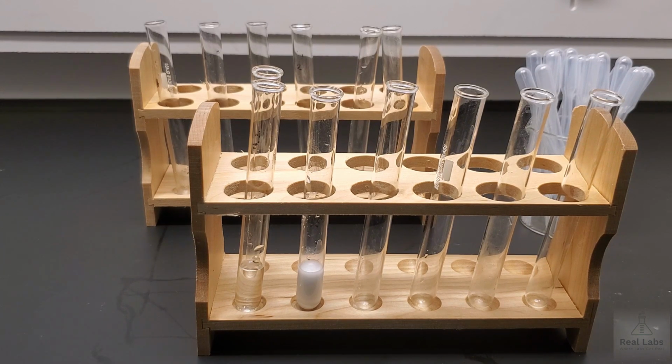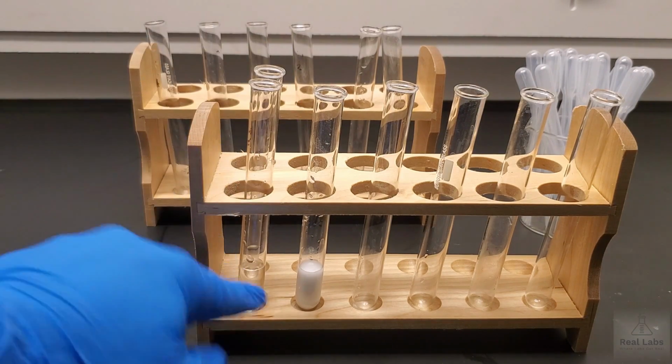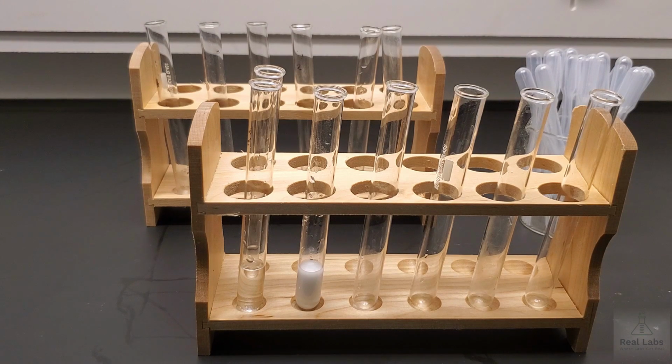If a reaction occurs, sometimes it may look like this first one looks clear, looks like nothing happened, but the bottom of the test tube itself may feel warm. A change in temperature indicates that a reaction did indeed occur, and you should make a note of that. So we're going to keep working through this, but we're going to keep an eye on all of those observations as we go.